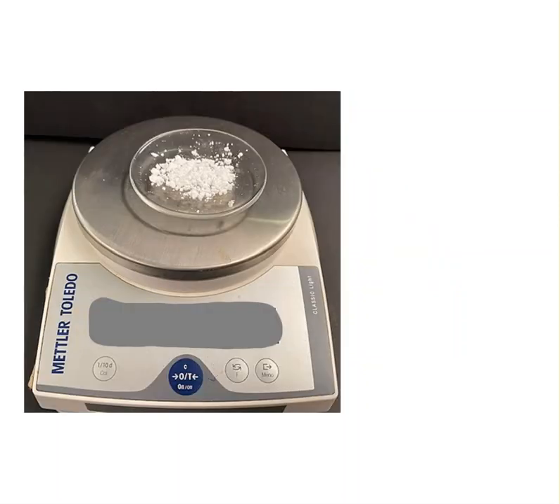Next, we put our aspirin onto the watch glass and we weigh it again, and this will be D for the numbers you're given. And also you should note what the aspirin looks like. That's part of what you need to use to say that, yes, I did make aspirin. On your conclusion, you should include your theoretical yield, your actual yield, your percent yield, and your observations about what this looks like. All of those go into whether or not you made aspirin, which was your goal for this experiment.